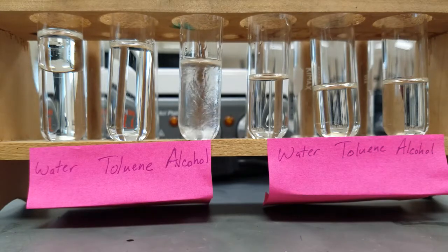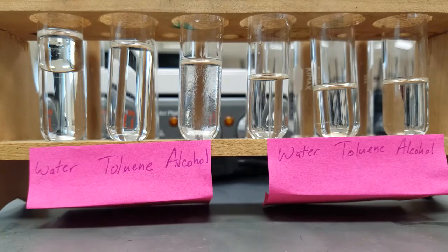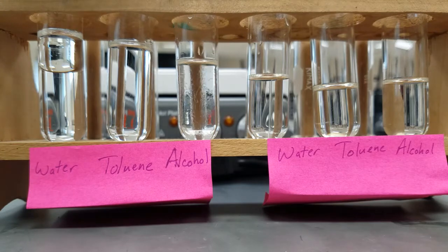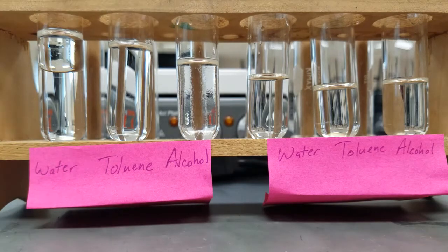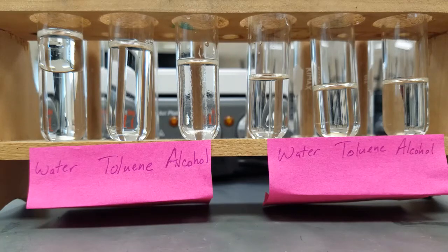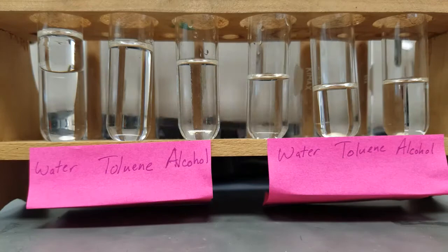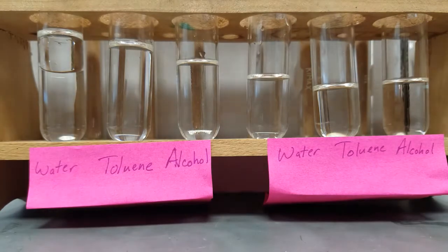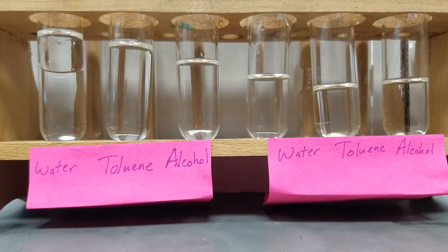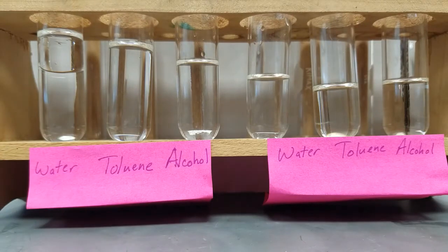Our alcohol and xylene — although you see a little bit of waviness, that's a difference in density that you're seeing — but there are no distinct layers between them. And so xylene would be insoluble in water, soluble in toluene, and soluble in alcohol.